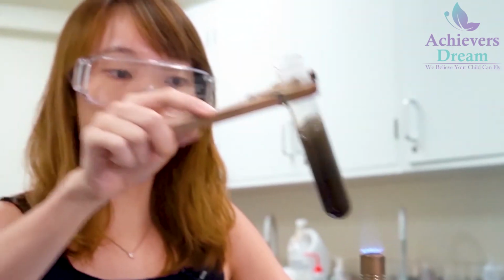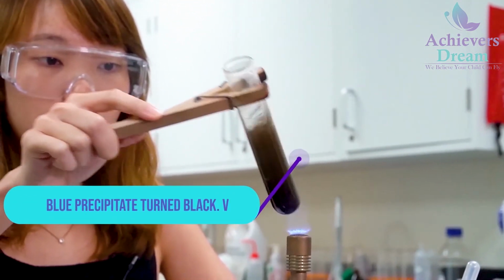Okay, so you see that all your blue precipitate has turned to a black precipitate.